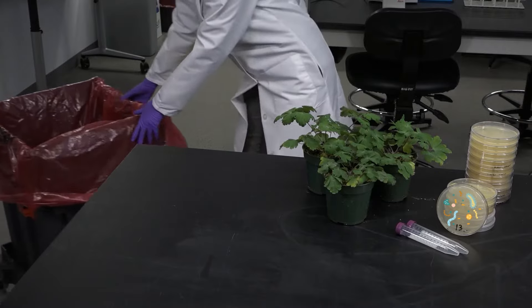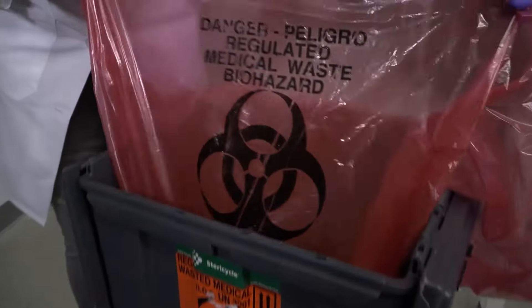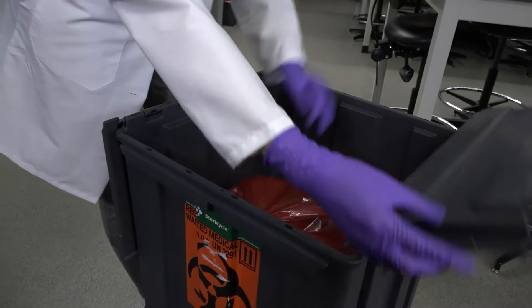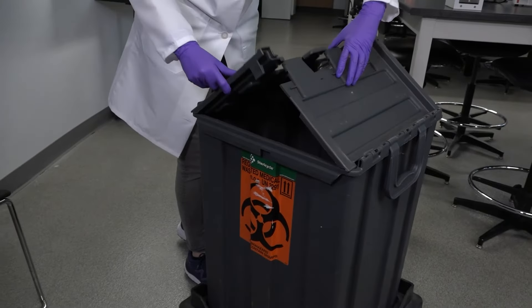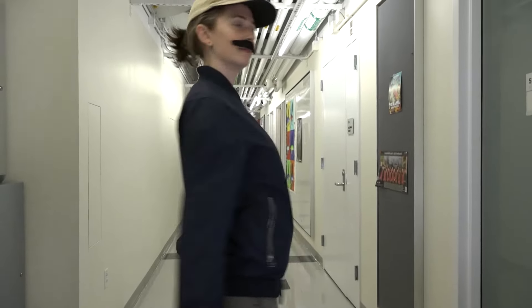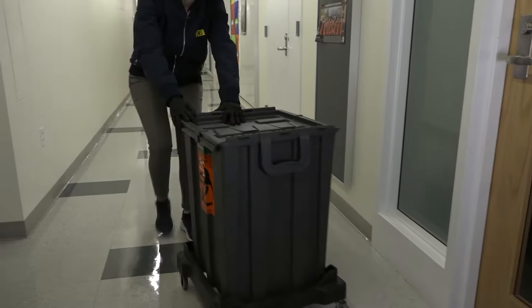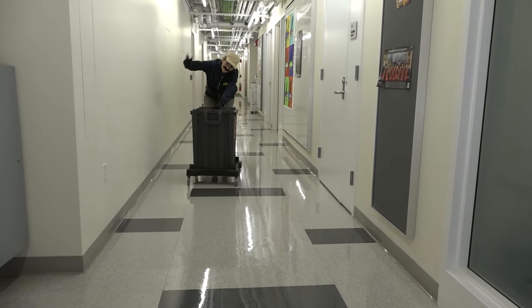Solids can be disposed of in designated biowaste containers. These containers are lined with a red bag stamped with the universal symbol for biowaste. When they're three quarters full, tie them with a single knot, close the bin, and dispose of them according to EHS guidelines. In our case, we leave them outside our lab to be collected by trained personnel. The waste will be sent to a facility to be exposed to radio waves or incinerated to neutralize the biohazard before disposal.